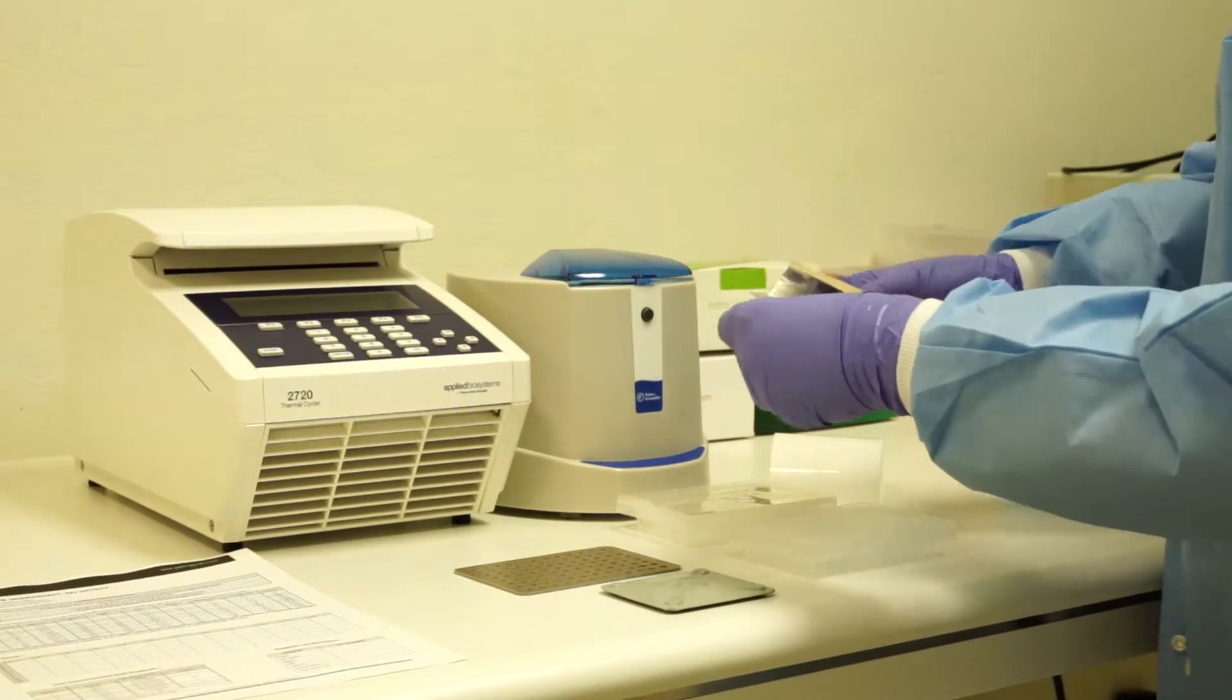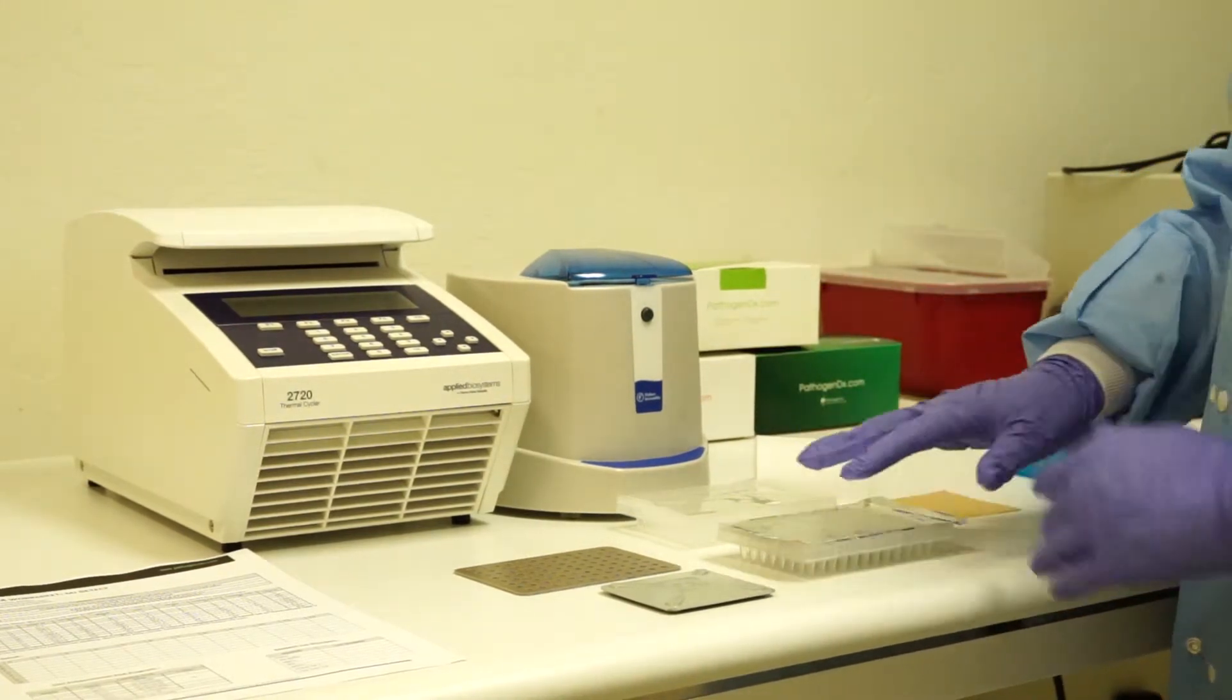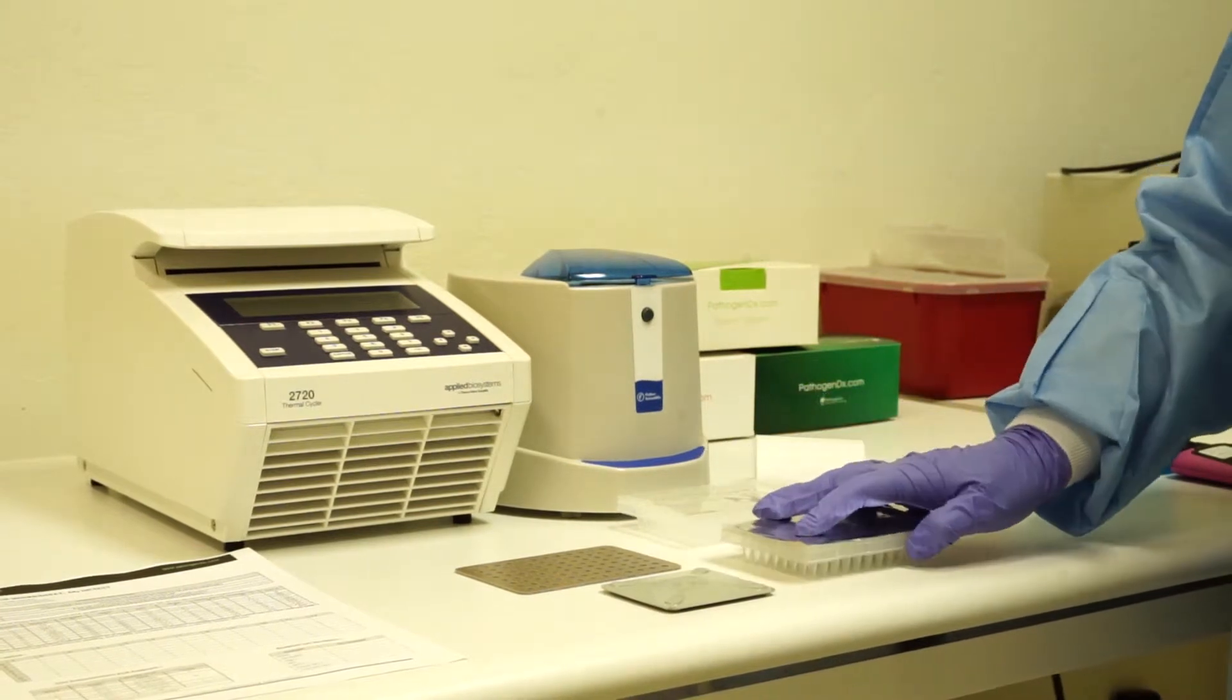If you want to keep the loci PCR product, use a foil seal which may be placed in the fridge at 4 degrees for up to 2 weeks.